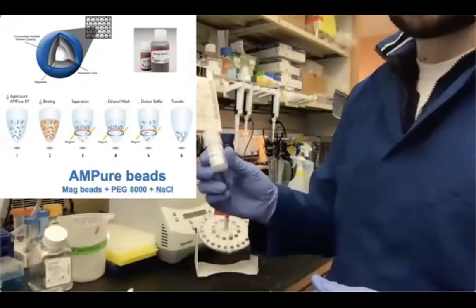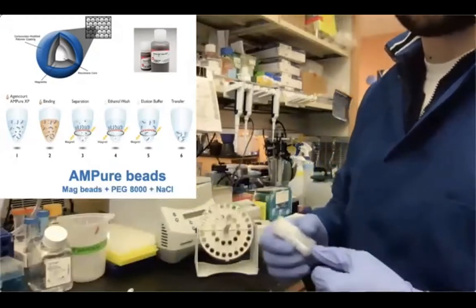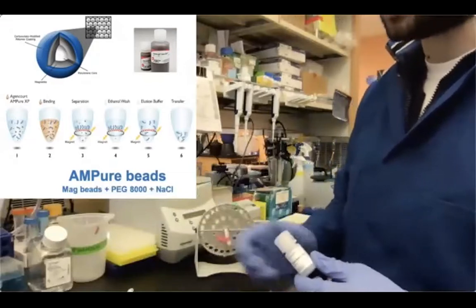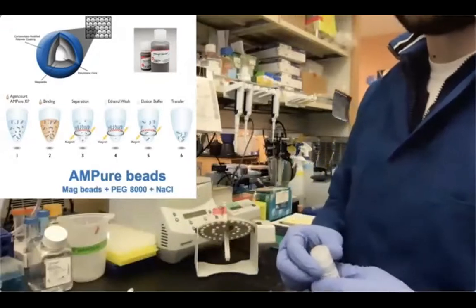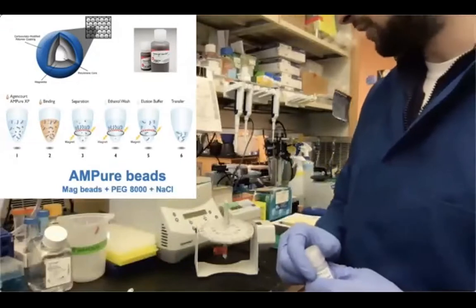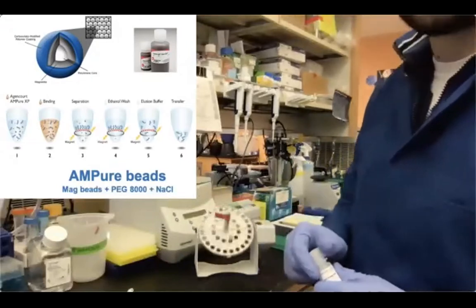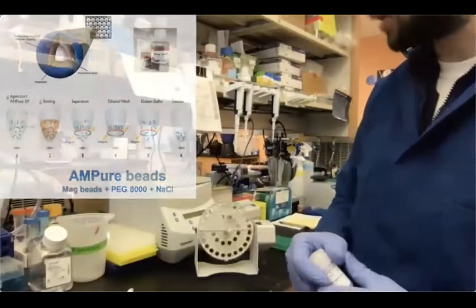If you have AMPure beads that are stored at 4 degrees, there are two things that you have to do. You have to warm them up to room temperature, and also you have to resuspend them, okay? So I usually take them out, briefly vortex them to resuspend them quickly, and then I usually transfer them into 2 ml tubes if I haven't done that already, and keep them rotating so they're resuspended and they reach room temperature at the same time.